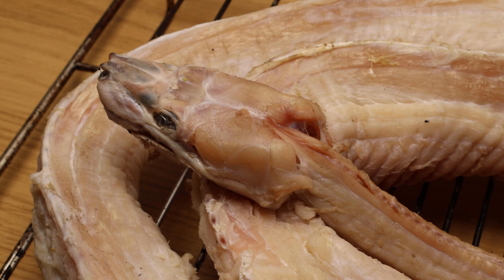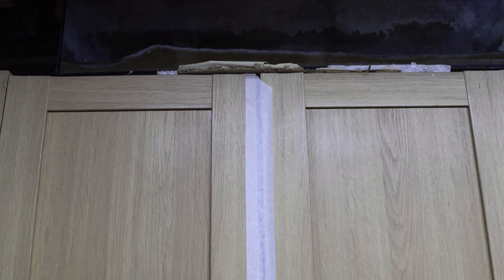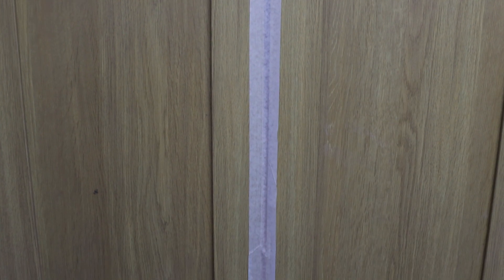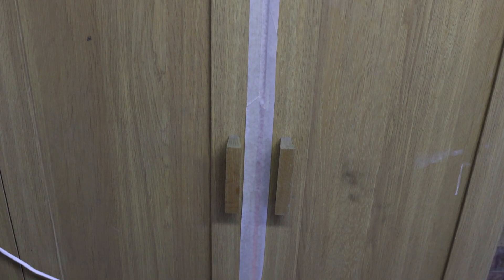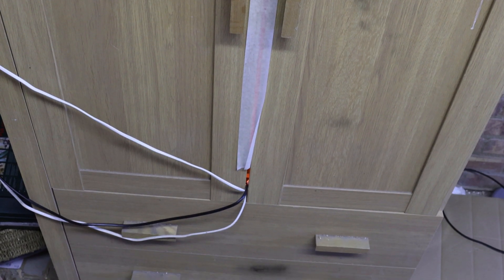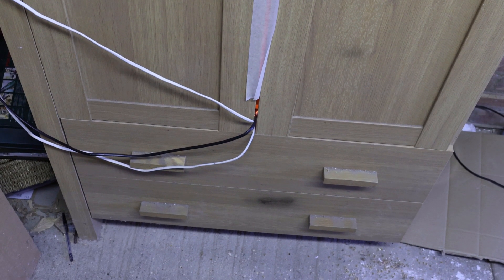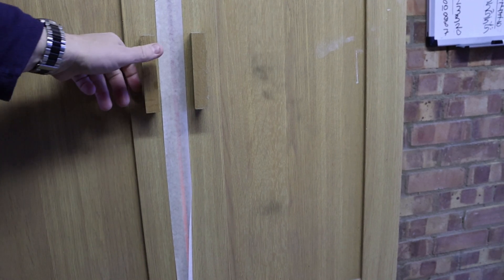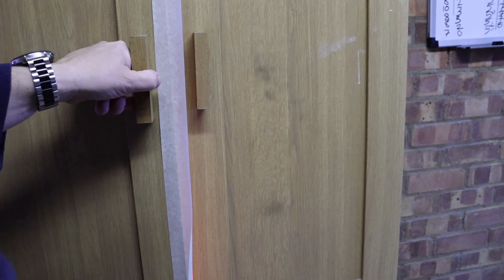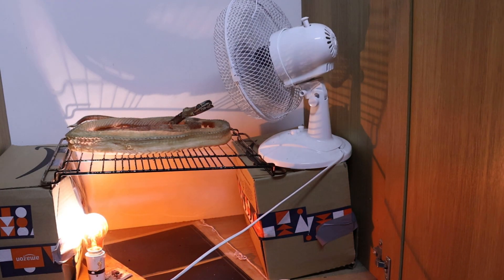As you can see there really isn't anything complicated here. I use boxes of various sizes and for the bigger specimens this state-of-the-art dehydrating facility — an old wardrobe in a garage. The trick is to bathe the specimen in a continuous stream of warm dry air. The tape over the doors helps keep air in, and the gap at the bottom and top work together like a flue, drawing cold air in through the bottom which is then warmed and rises to escape through the top, hopefully loaded with moisture from the specimen. Inside is an old-fashioned incandescent light bulb and a heat mat that provide the dry heat, and a fan to move the warmed air around the specimen.